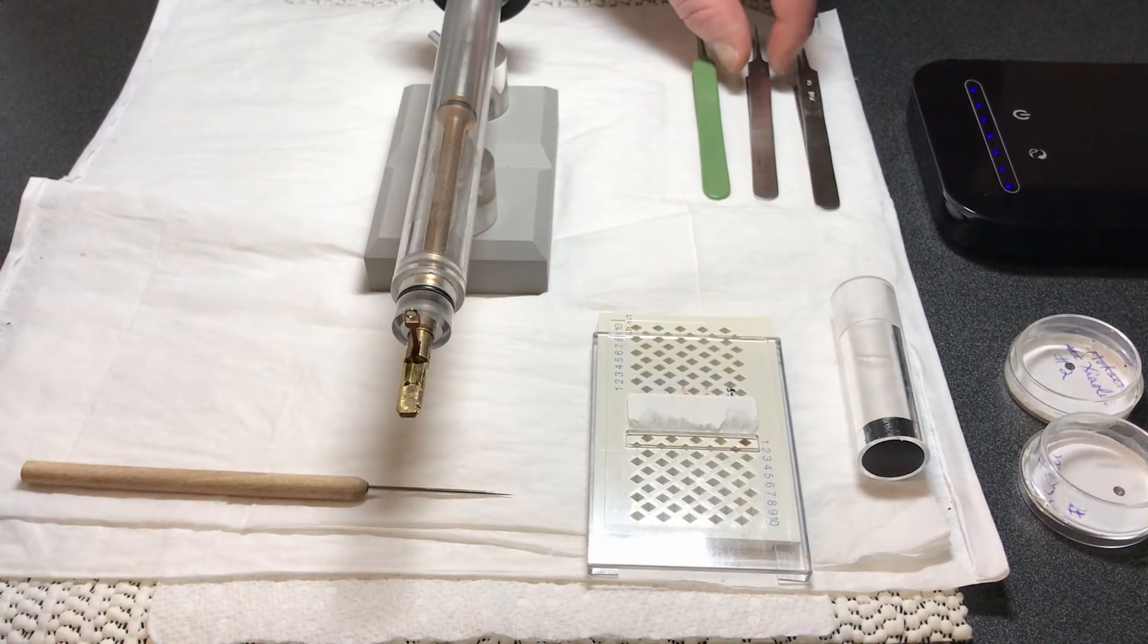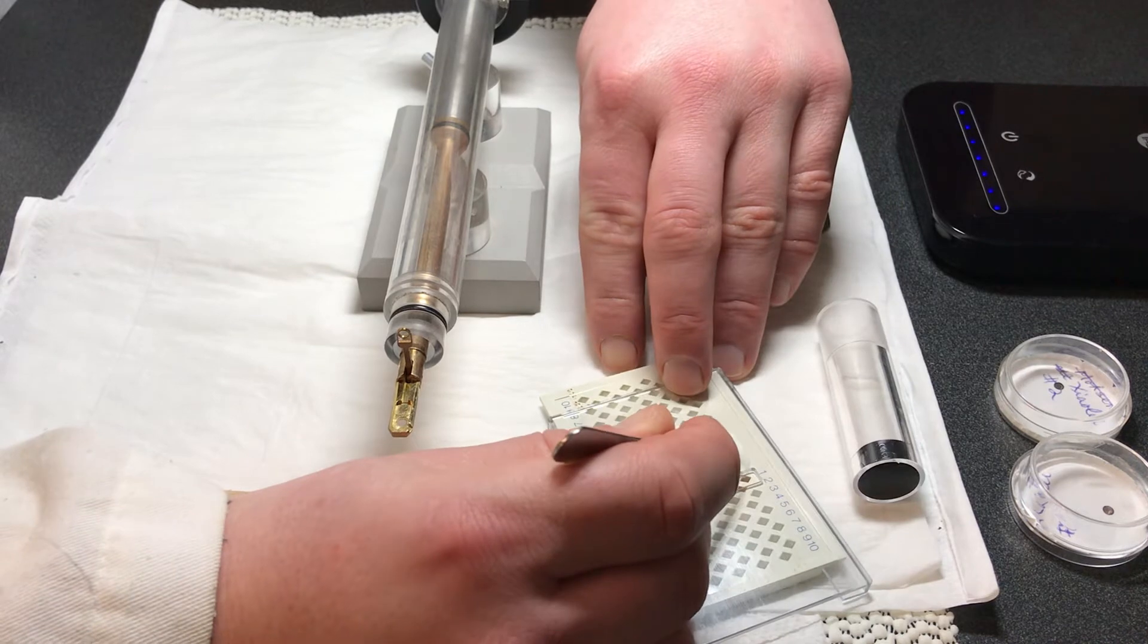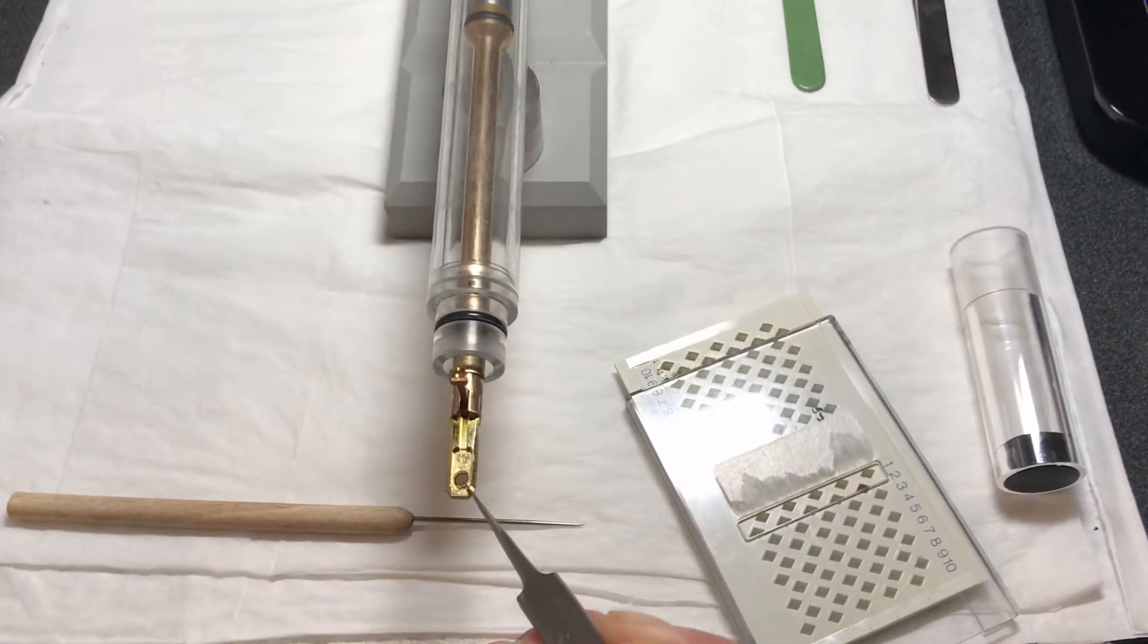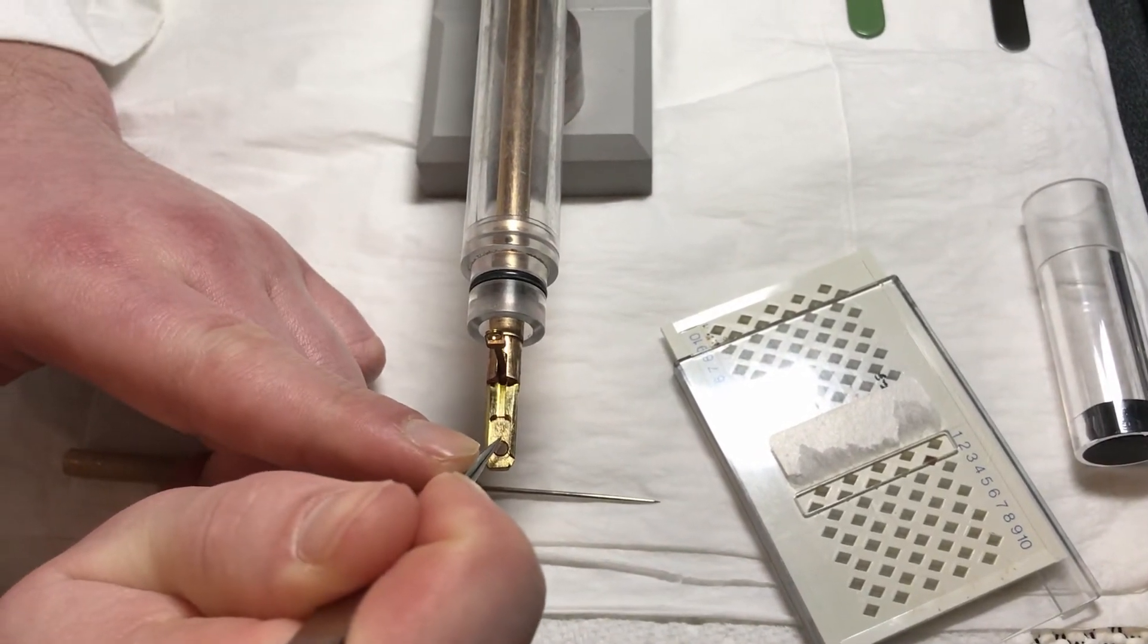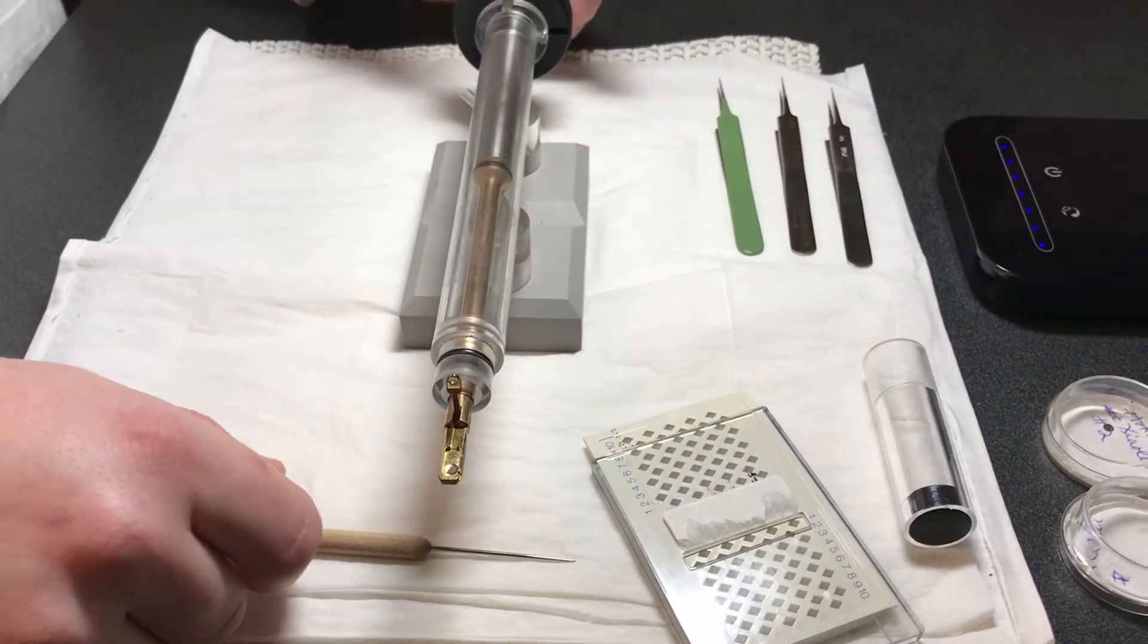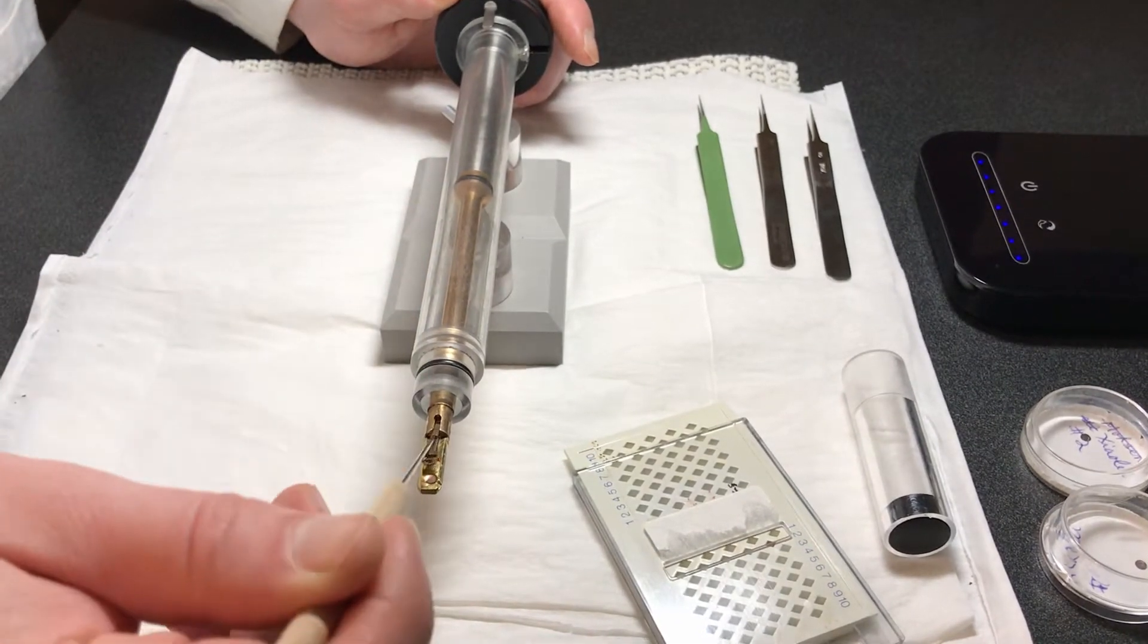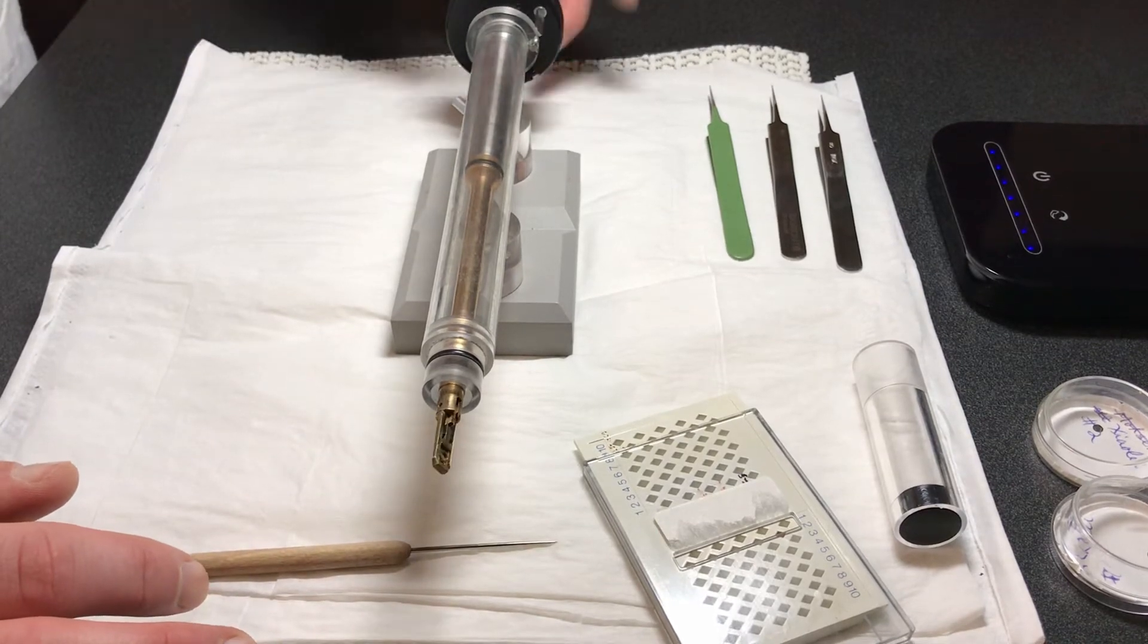We use one hand to hold back the end of the holder to prevent it from slipping out of the station, and insert the pin into the pin hole in the grid clamp and gently raise the clamp straight up until it stops. Then using fine tweezers, we pick up a grid from the grid box and place it into the recess at the end of the holder, making sure the grid and bottom hole are aligned concentrically. Then we lower the clamp with the loading pin to lock the grid and turn the holder upside down to make sure the grid doesn't fall onto the working station.